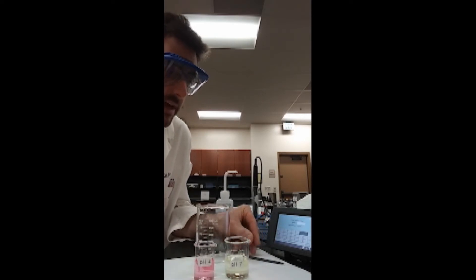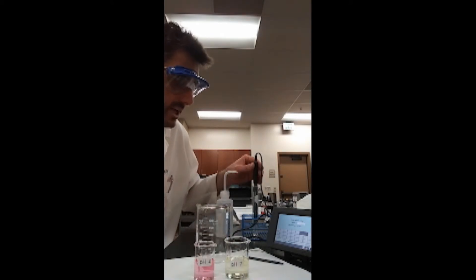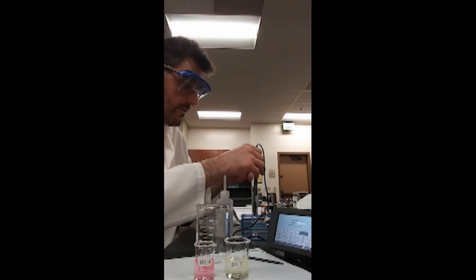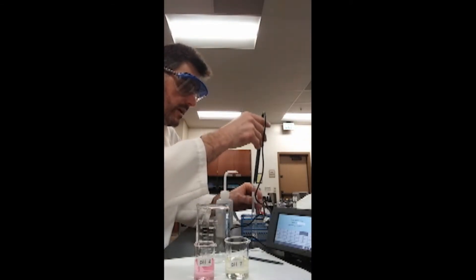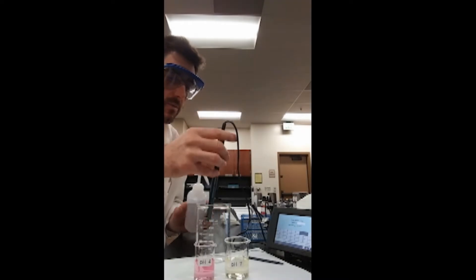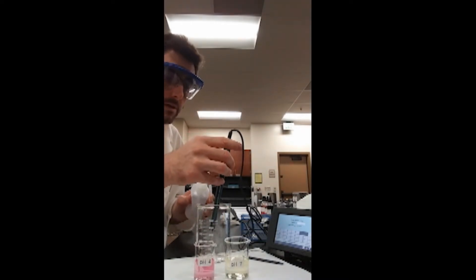And then we'll take our pH probe and immerse it into the pH 7 buffer solution. Before I do that, however, I'll take the time to rinse off the probe using liberal amounts of deionized water.